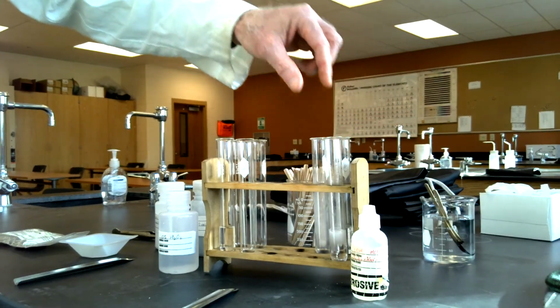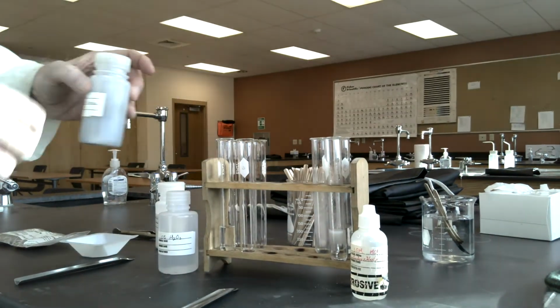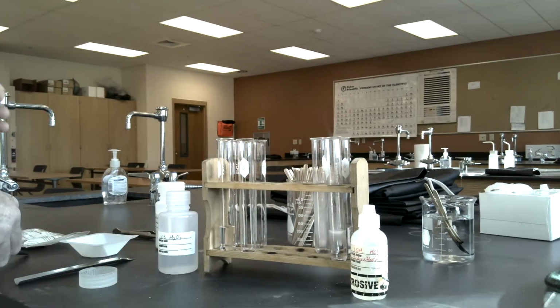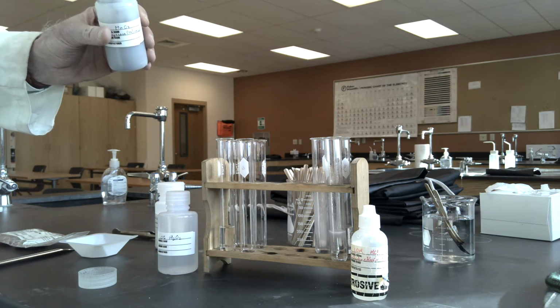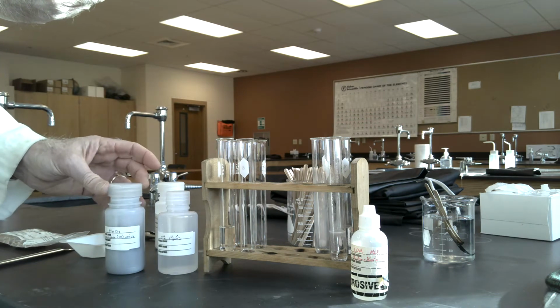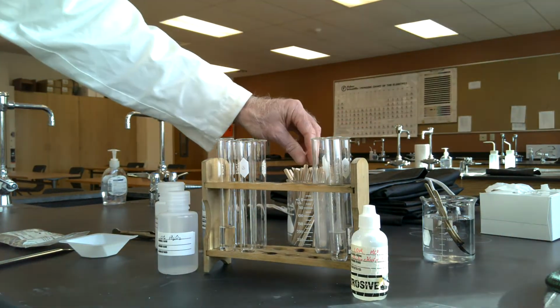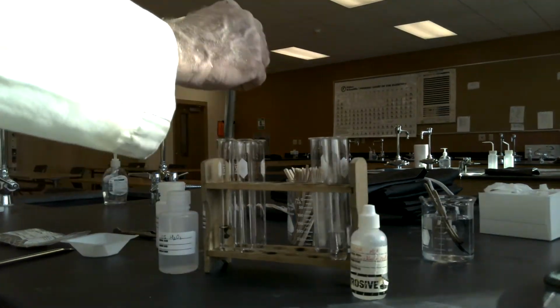Another gas is one that can be evolved by hydrogen peroxide. And hydrogen peroxide is what many people use to alleviate the infections that could arise from minor cuts. So I'm going to use a little bit of manganese 4 oxide. Manganese 4 oxide is not a reactant here. It actually is a catalyst. It's going to help the reaction for the decomposition of hydrogen peroxide to occur, but will not itself be consumed in the reaction. I could recover it all if I wanted to. So I'm going to add that in.